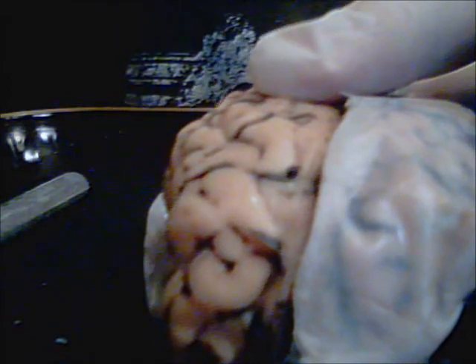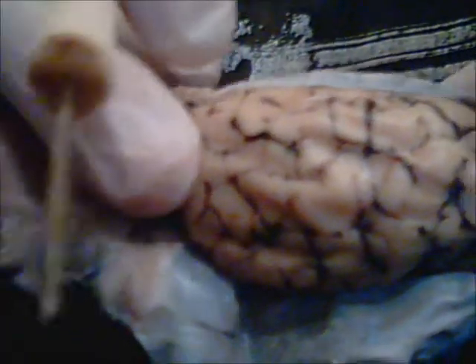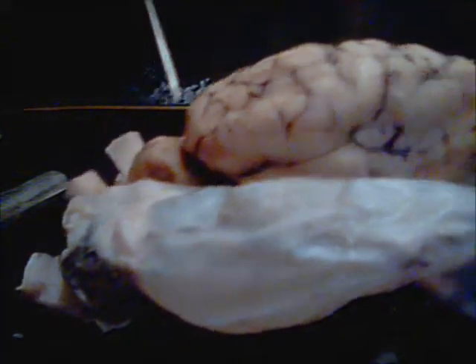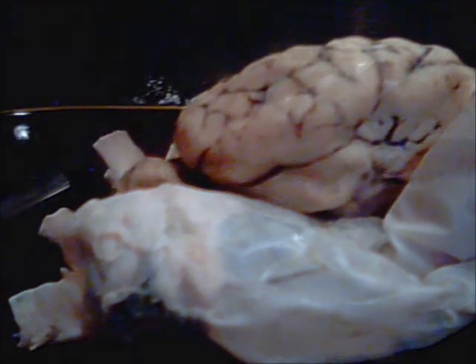Posterior, occipital, cerebellum, temporal lobe, down in here, and our lateral fissure. I think that one's going to be hard to find as well. I don't see anything that's distinctive in a lateral fissure for this sheep. Well, that might be it right there. I think we already did that somewhat anyways. I probably pointed someplace else.